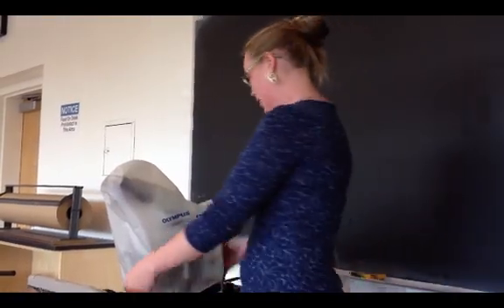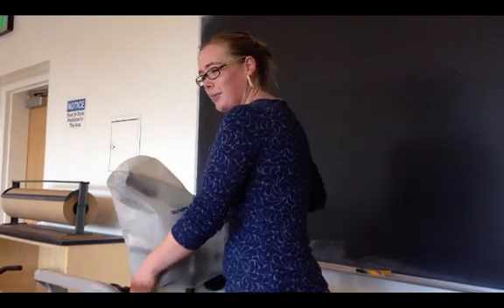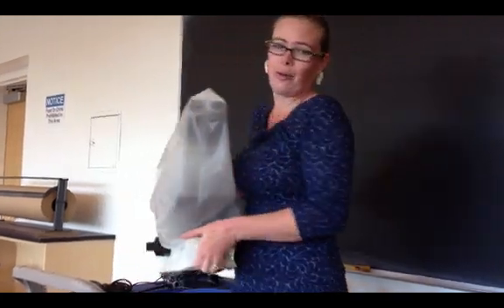When you're ready to pick up your microscope, use two hands. These are very expensive and you don't want to drop them.